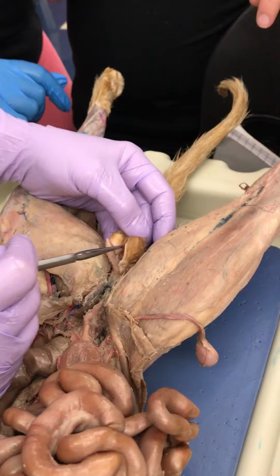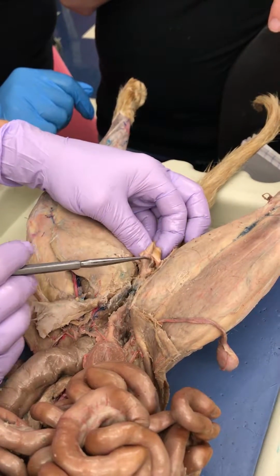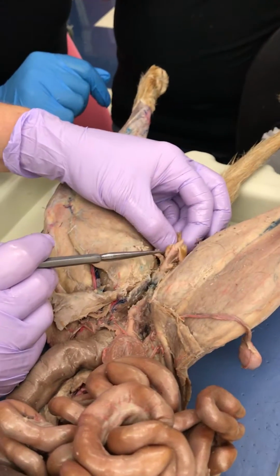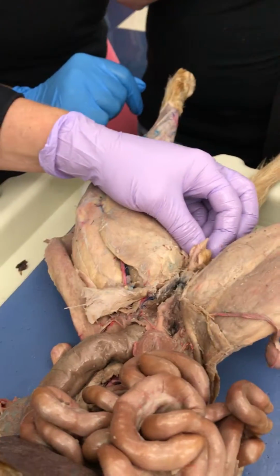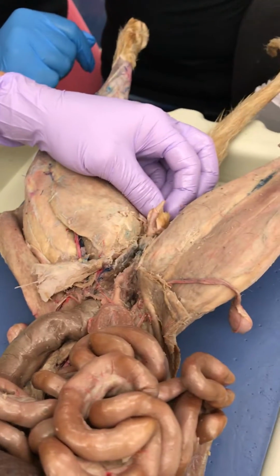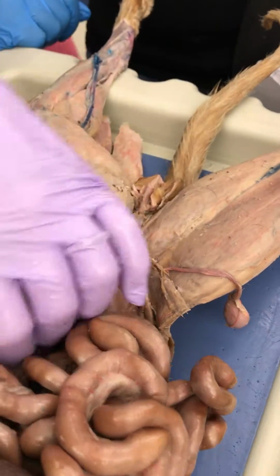Okay, what do you call this sac that the testicles were removed from? Scrotum. And what do you call the skin that we pulled back from the penis? That's what your patients call it. What are you going to call it? Oh shoot, I don't remember. Prepuce. It's the foreskin. Prepuce is foreskin. All right.